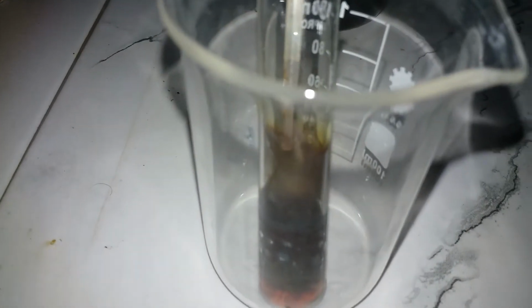And now to the iodine hydriodic solution in the test tube, I'm gonna add some nitric acid to oxidize the iodine out. So 3, 2, 1, there we go. Oh, okay. That's similar to, well, sulfuric acid, and the iodine actually precipitates out really fast.